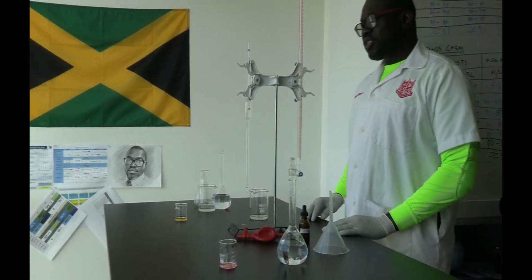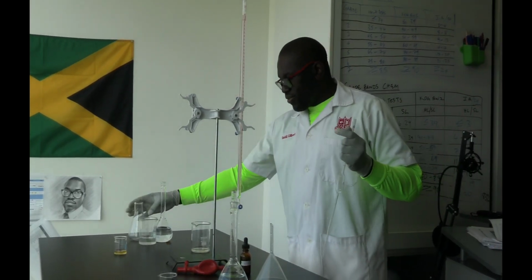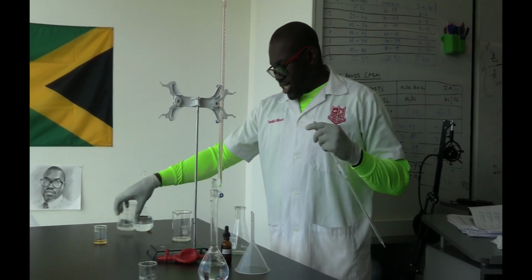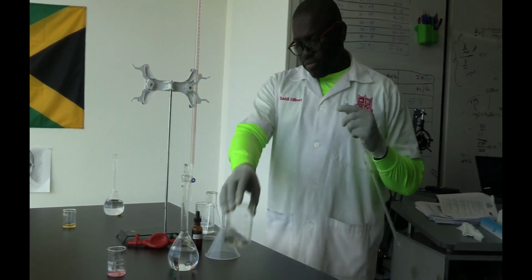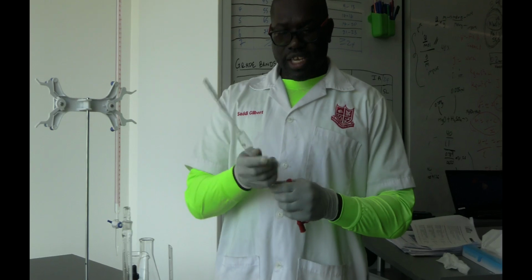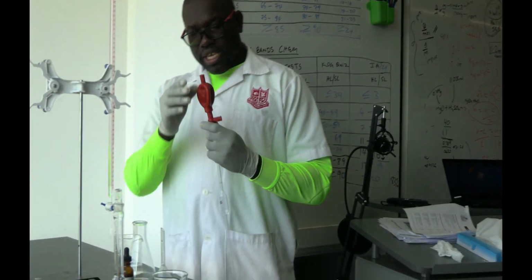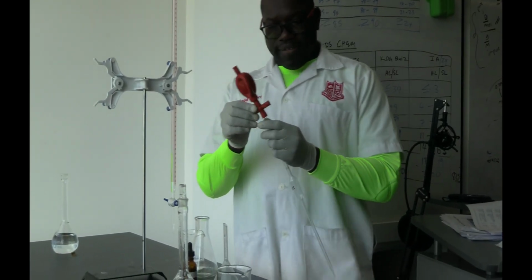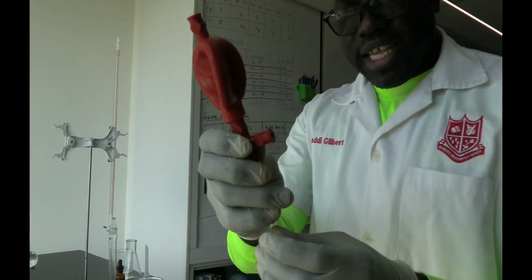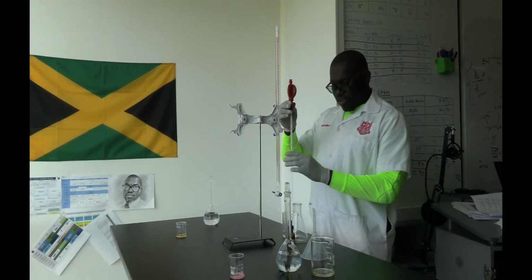Now, I've done that. What I'm going to be doing now is pipetting my sodium hydroxide into my conical flask. So this is my Erlenmeyer or conical flask. So I'm going to pipette my sodium hydroxide into this. So I take my pipette filler, hold it short, because if you hold it long it can break. So you hold it short and you simply fold it in. There you go. And then on your pipette filler you have S, which really means to suck the solution, and you have E to empty it. Right? And so what I'm going to do is just get the solution in here.